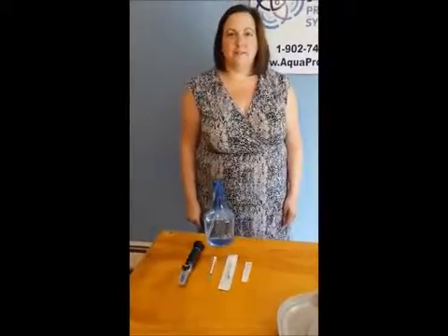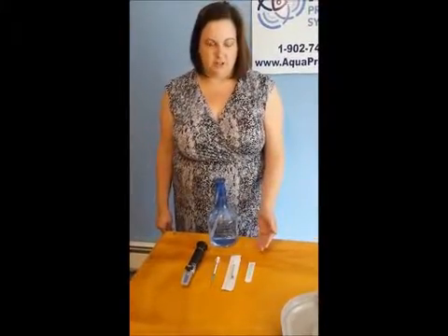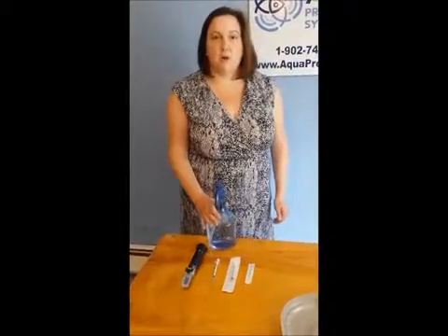Hi, I'm Nicola Gayosh, the office manager, and today we're going to be demonstrating the levels of protein in a lobster by a calibrated refractometer. Today we're going to use the following equipment: our 21 gauge needle and a 1 milliliter syringe, our refractometer, and our distilled water.